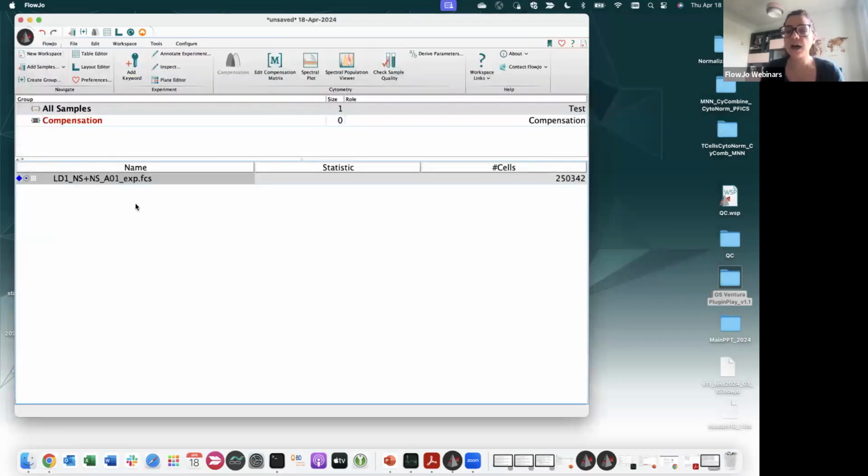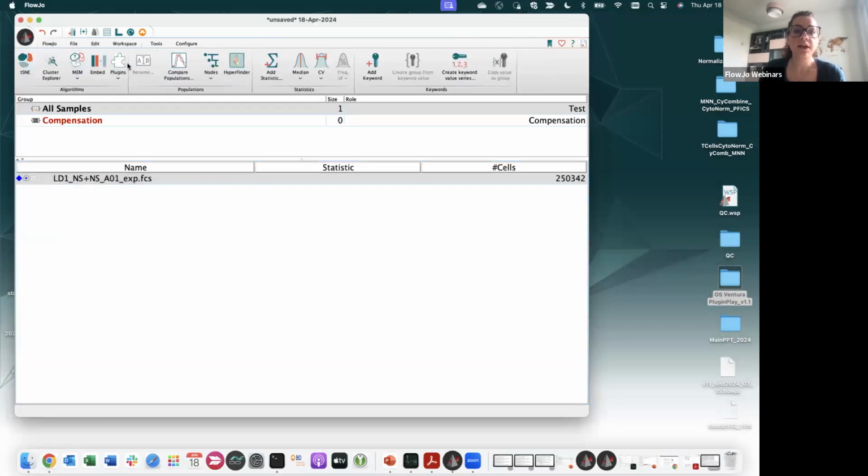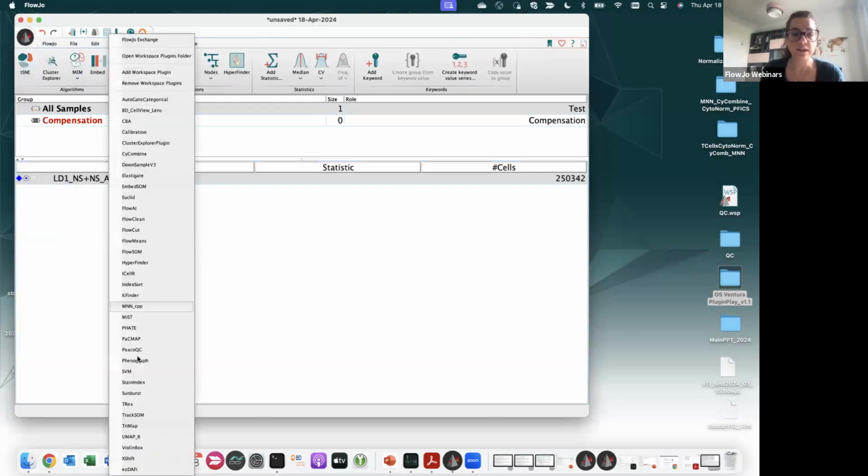In case you download Plug and Play, you may want to copy and paste the jar file into the plugin folder. Don't forget, this information is in the PDF file that comes with it. And once you quit and reopen FlowJo, you will find them under the plugins list right here. Now, your list may be shorter than mine. That's not a problem.